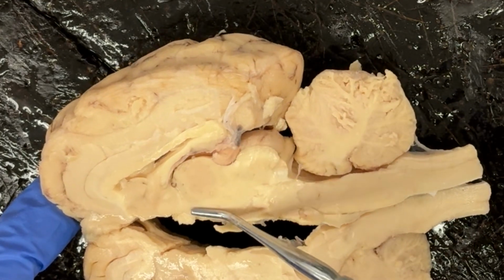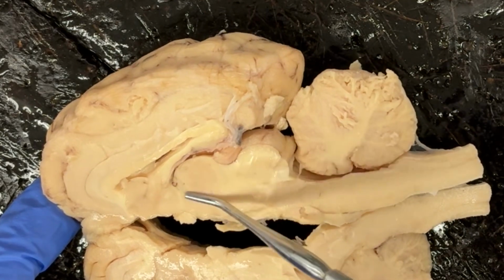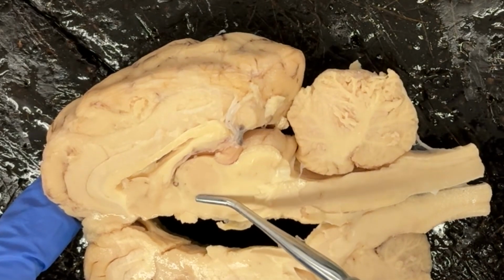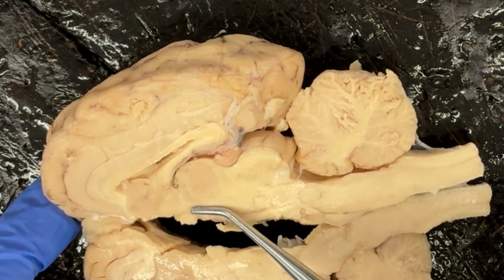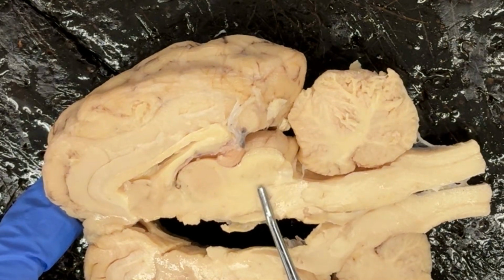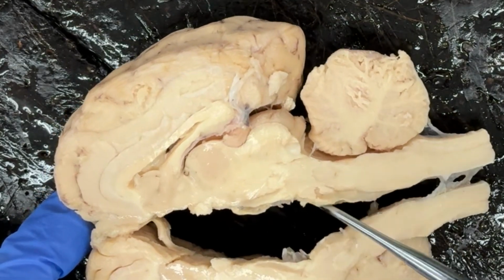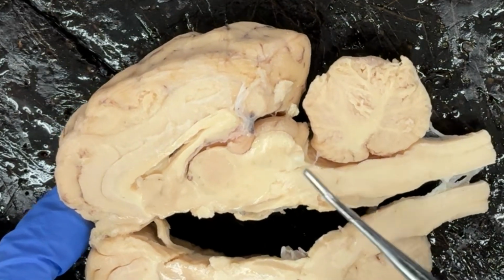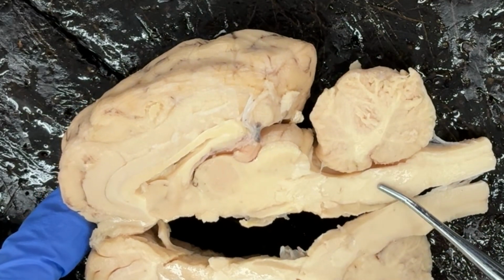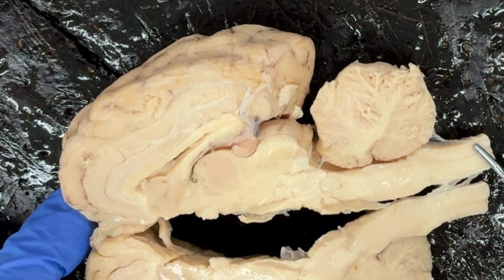Now below the thalamus is the hypothalamus. Hypo means below. So once you find the thalamus, then you know below the thalamus is going to be the hypothalamus. And then we can find the brain structures from this orientation as well. So we would have the midbrain, and then again, when the brain stem kind of makes a little bit of a belly, then we have the pons, and that's going to be followed by the medulla oblongata, and then that will eventually connect with the spinal cord.